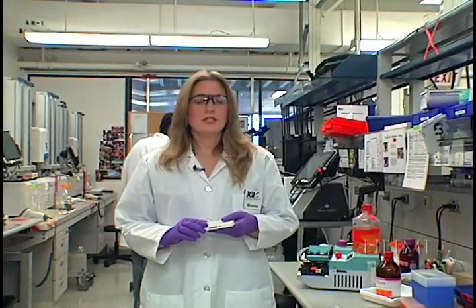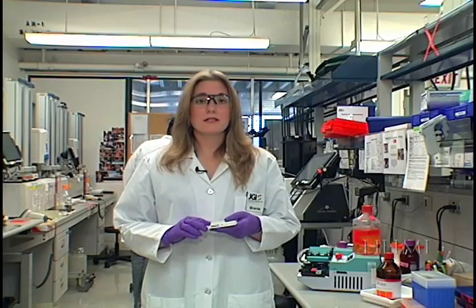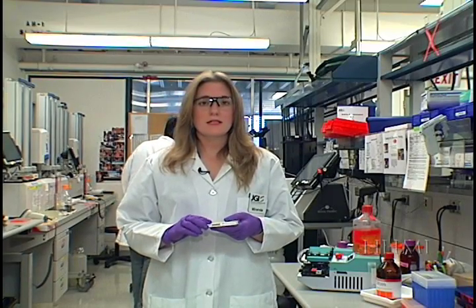Now we allow this solution to incubate for another 18 hours at 30 degrees Celsius. We do this by placing it in an incubator.